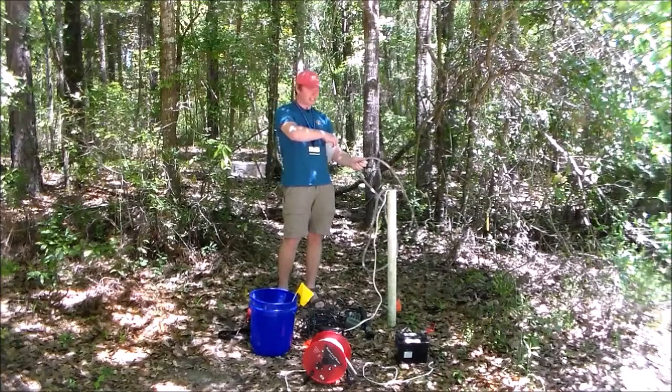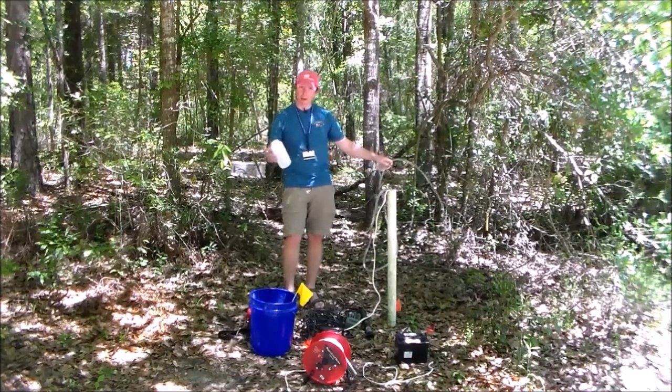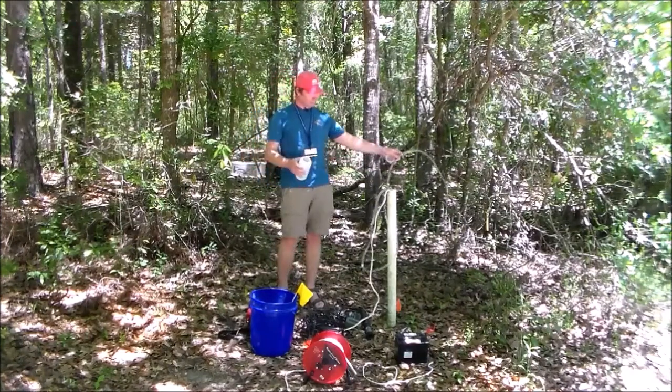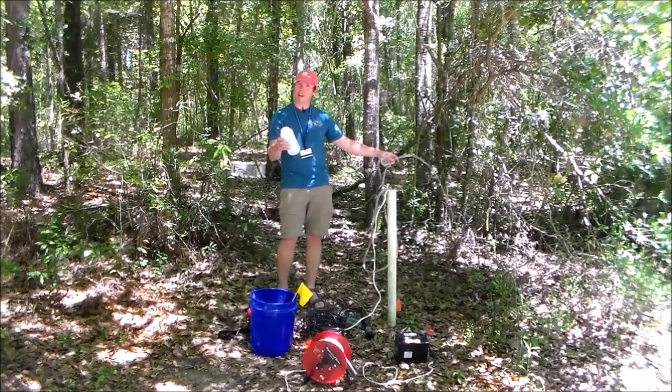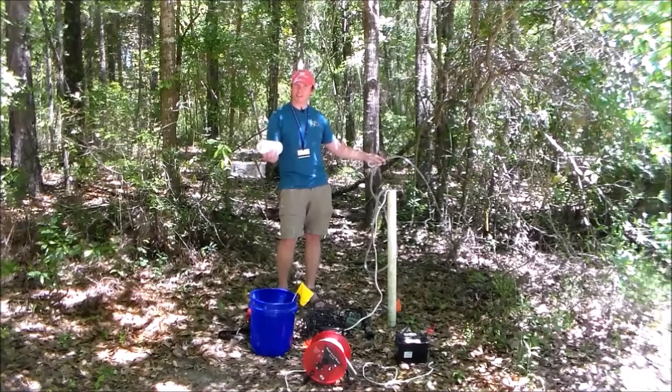All right, so I'm back. It's been about 5 minutes or so. I'm ready to sample. I've purged my well, in other words. And so what I'm going to do is I'm just going to fill this thing up. I'm gonna let it overflow a little while. Basically, I don't want the water splashing in there because that's gonna bring up the oxygen concentration.